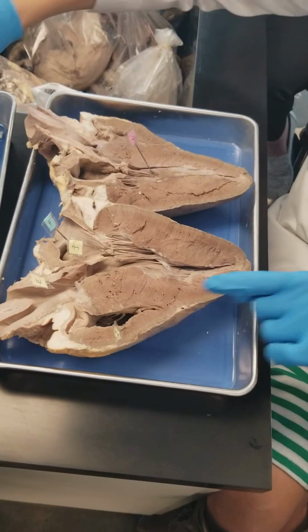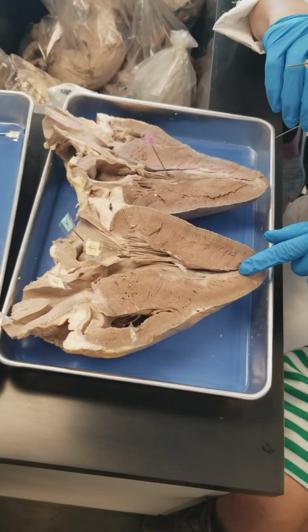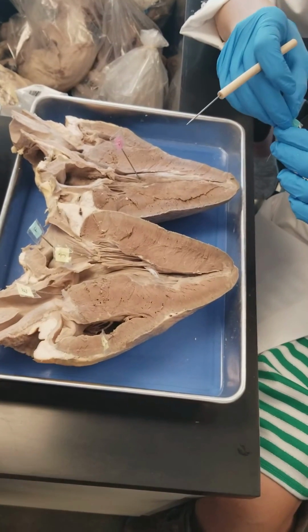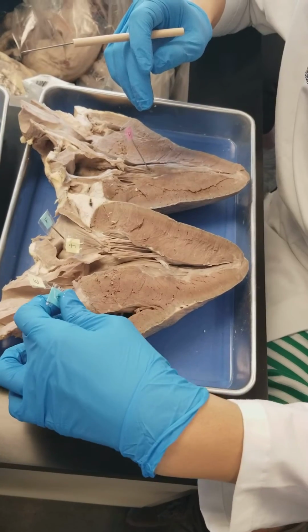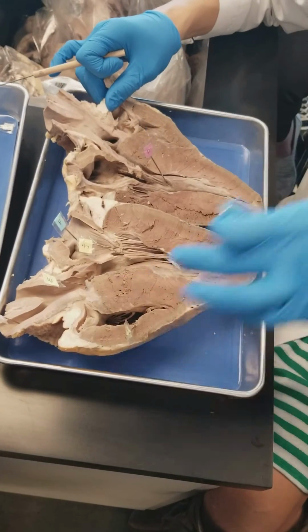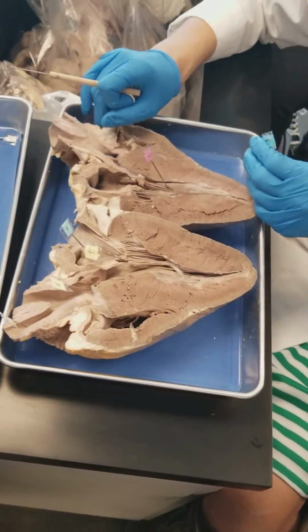How is that the right ventricle? That's at the top. This is the left ventricle. So there's only one other ventricle. That will be the right one. And then the atrium is that little area on the top. Maybe she moved it with her finger. Yeah, I guess that would be the right atrium up there. I got very little of it here, but there's more of it right there. All of it is back there.